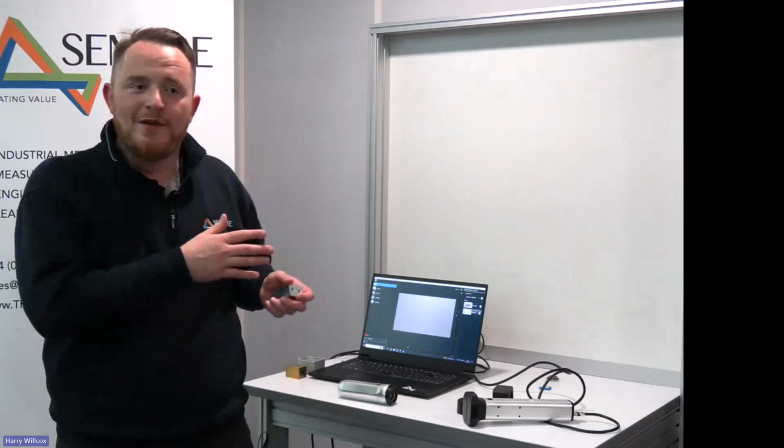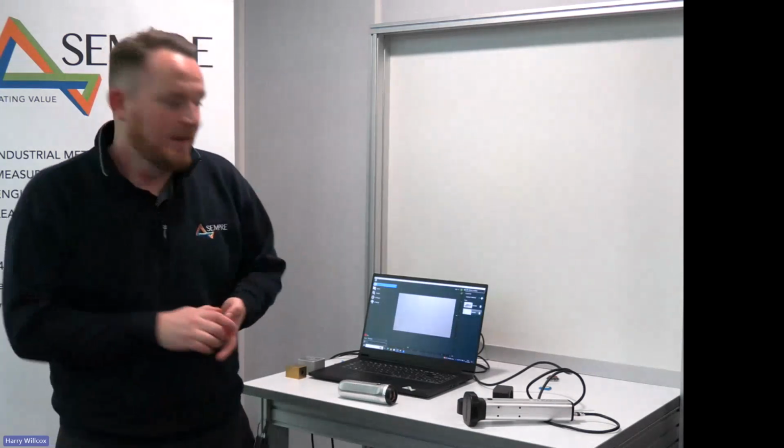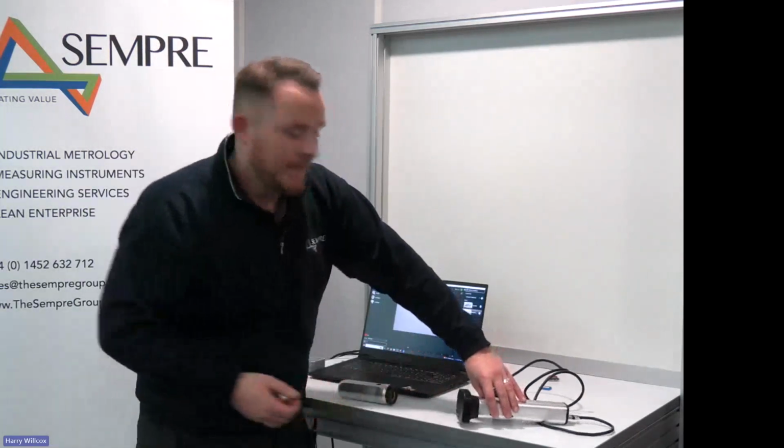I've seen customers that have used pads that have done 400 scans and they're still calibrating really well and not having any issues. It comes back to the analogy that although it's handheld, we're trying to chase single-digit micron measurement accuracies, so we need to look after it as best we can. So we clean the surface before we measure it to remove any oil or grease or loose debris on the component, and then look after the pad, place the lid onto it after we've used it, and also run through the cleaning process.